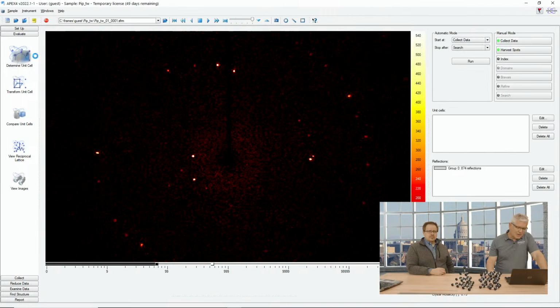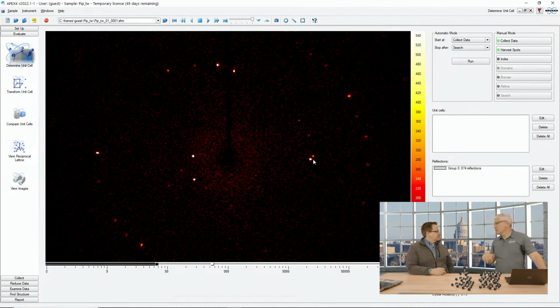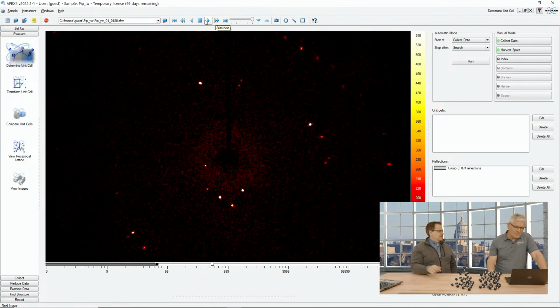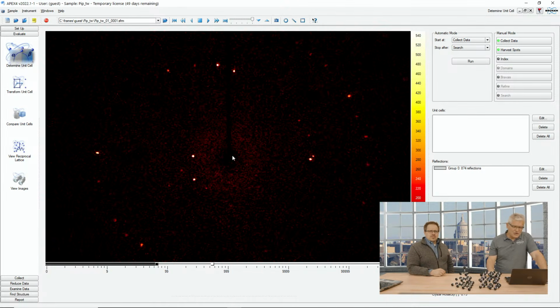So let's look at some diffraction patterns here. In the single crystal world, we don't get the rings, we get individual spots. And I can just play a little movie, which gives you an idea of how these reflections look. Kind of looks like a starry night. Yeah, it does.